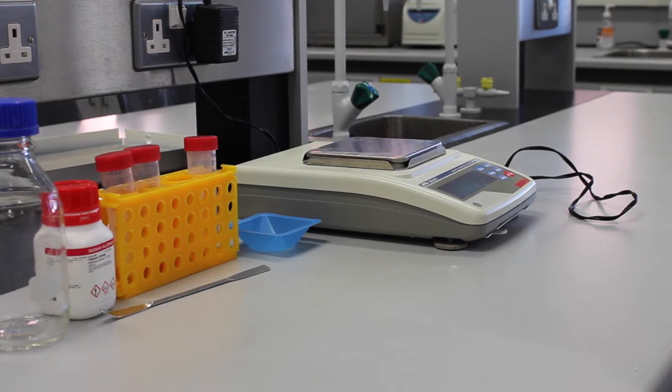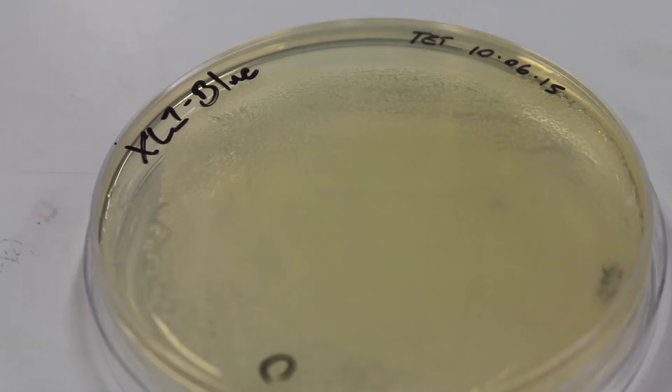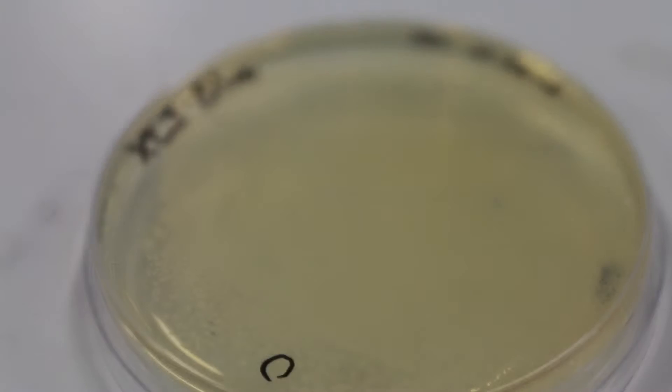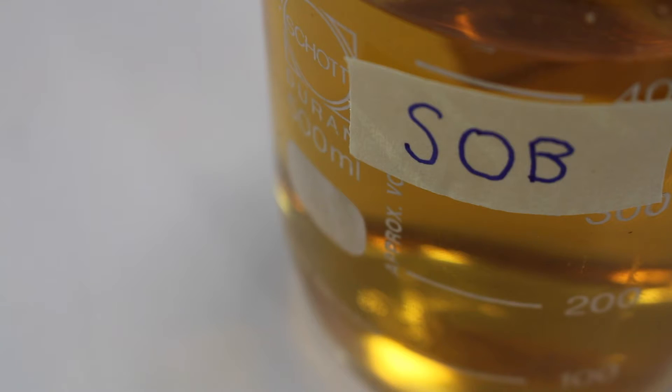For this protocol the following are required. An SOB plate containing single colonies. SOB medium, which you can learn how to prepare by clicking the link.